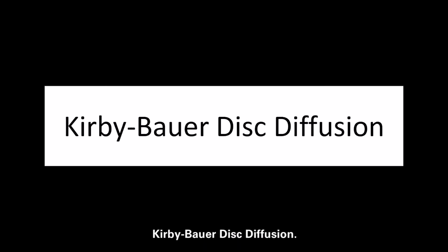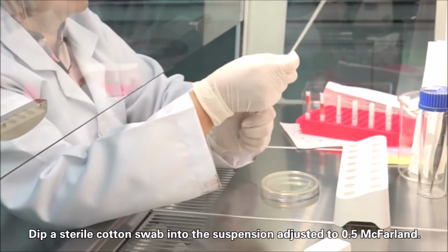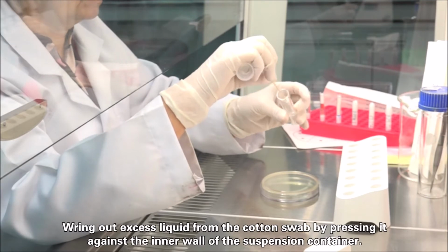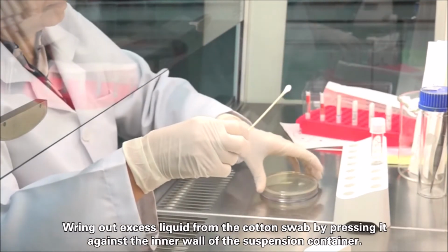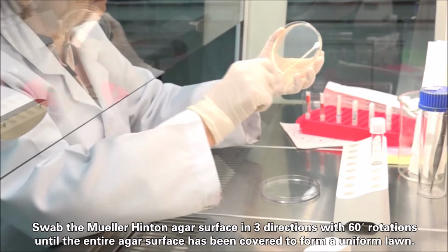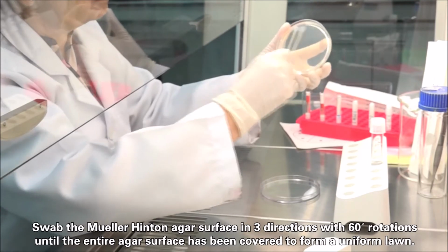Kirby-Bauer disc diffusion. Perform the Kirby-Bauer disc diffusion using the following procedure. Dip a sterile cotton swab into the suspension adjusted to 0.5 McFarland. Wring out excess liquid from the cotton swab by pressing it against the inner wall of the suspension container. Swab the Mueller-Hinton agar surface in 3 directions with 60-degree rotations until the entire agar surface has been covered to form a uniform lawn.